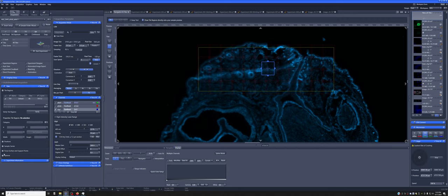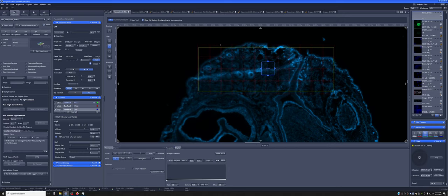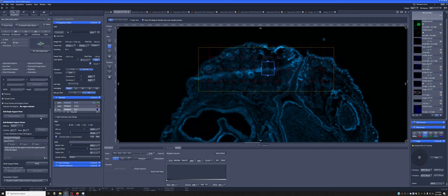Luckily, the software has a feature called focus surface and surface points and support points, which can help with this situation. Once you've created a tile that you want to image, you can add anchor points where you check the focus, and the software will then compensate in Z as it moves along. There are different ways of doing this, and you'll have to test the details. For example, here you have two methods of adding points, generic and onion skin, and you can add a certain number of columns and rows of points.